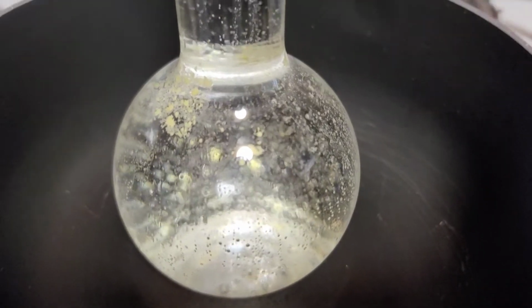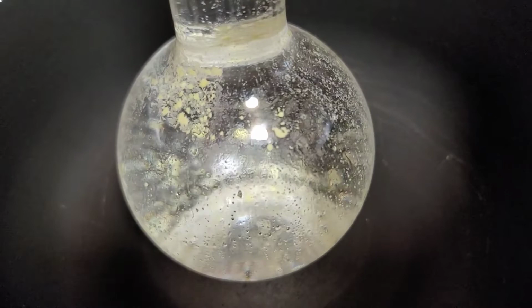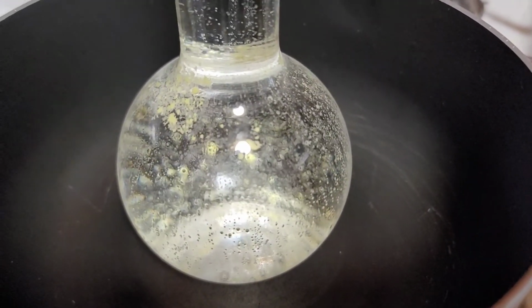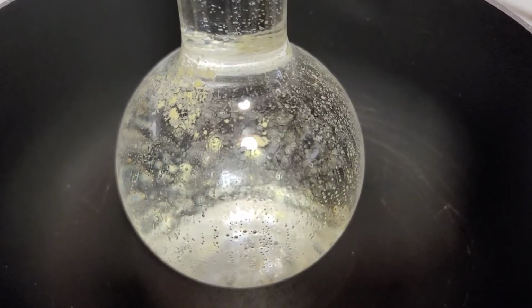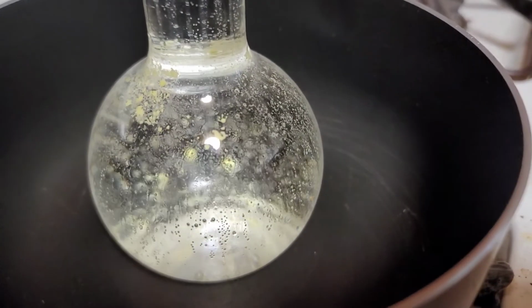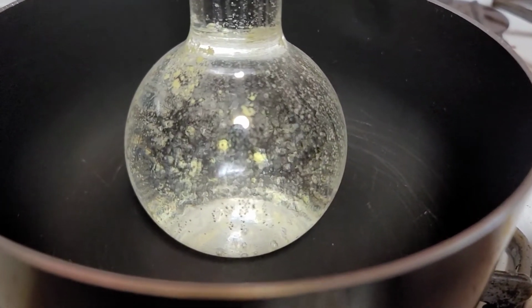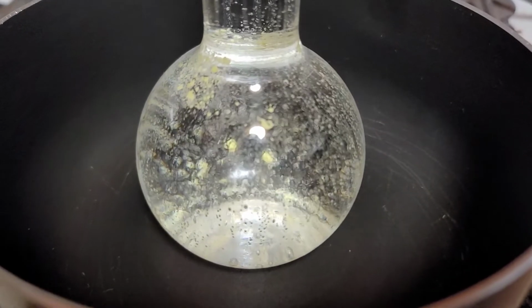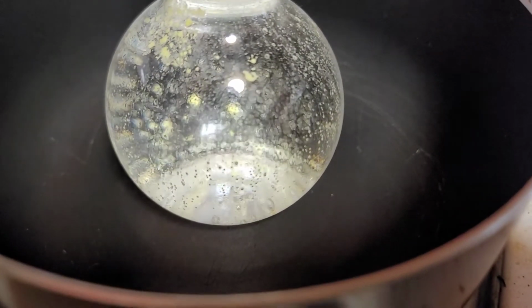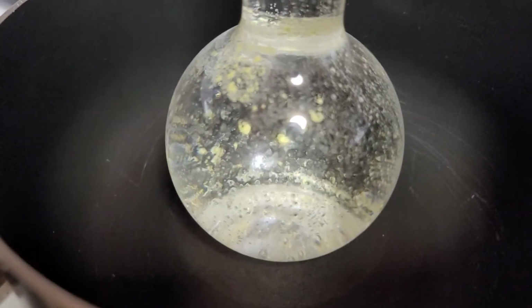So this experiment I do to clean this glass, it seems to be working. I'm not rushing it. I don't want to break the glass with too much heat. It is designed to take heat, but still, I don't want to overdo it. It is getting cleaner from this. This does seem to be helping.